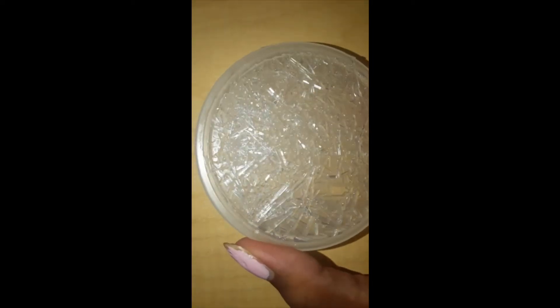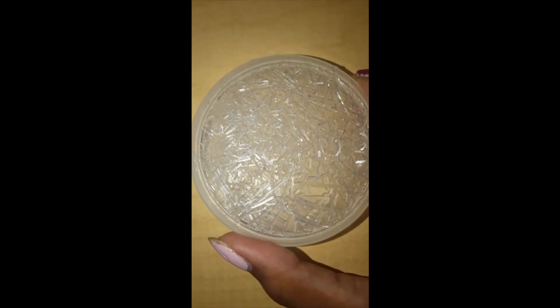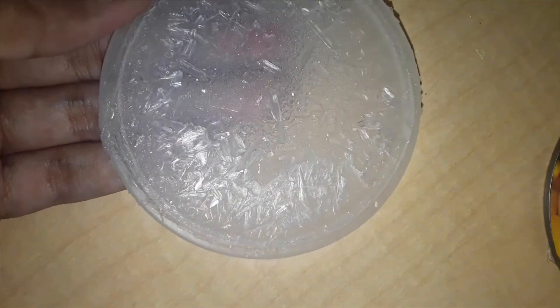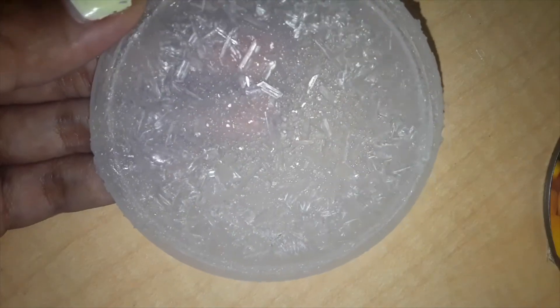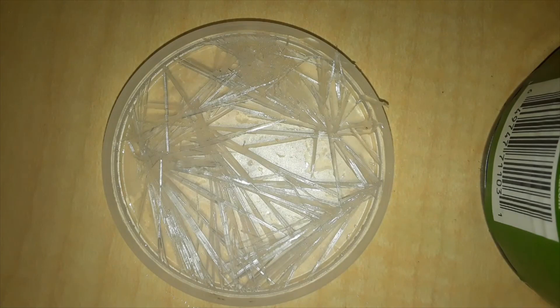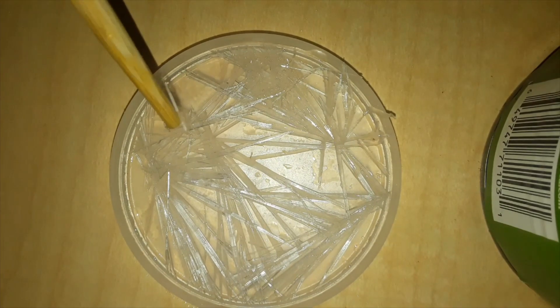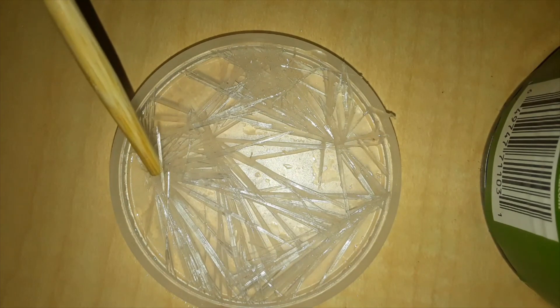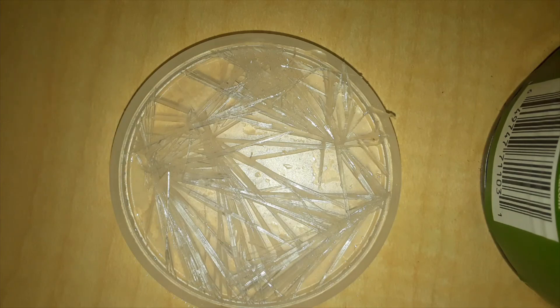This is what the end crystals look like — they look pretty good! You guys should try this out, try the procedure. I can't promise the recrystallization is going to be easy, but once you get crystals it's going to be really satisfying. And once you get the crystals, it's really easy to continuously recrystallize after that. Come on guys, try it out — it's gonna be great!